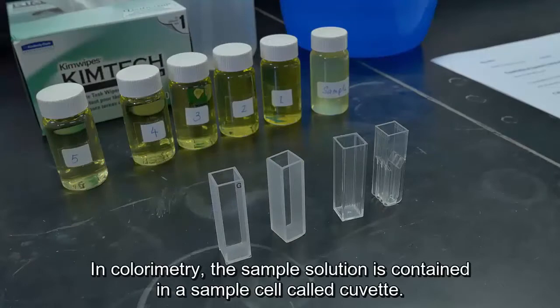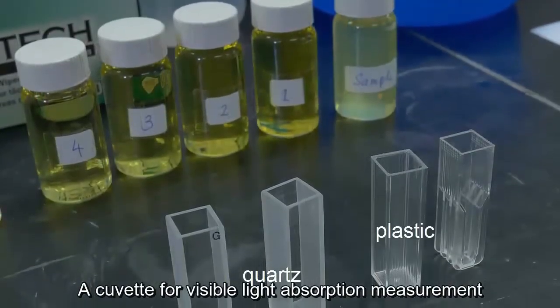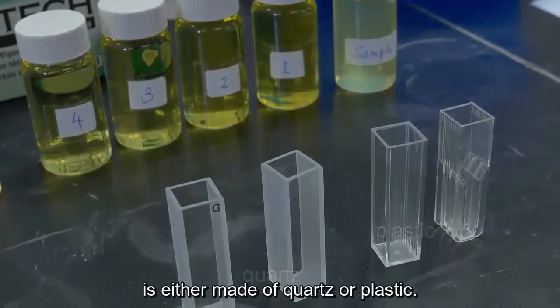In colorimetry, the sample solution is contained in a sample cell called a cuvette. A cuvette for visible light absorption measurement is either made of quartz or plastic.